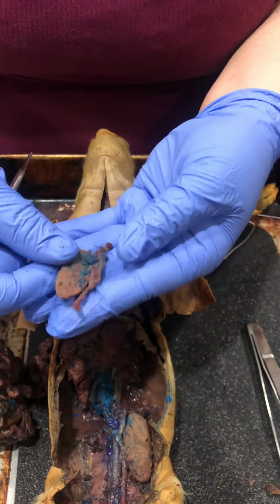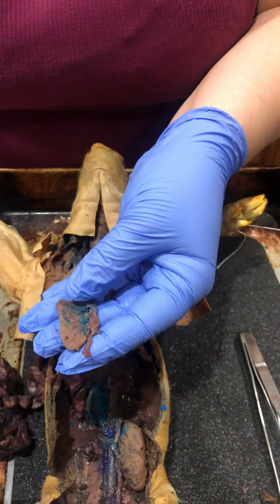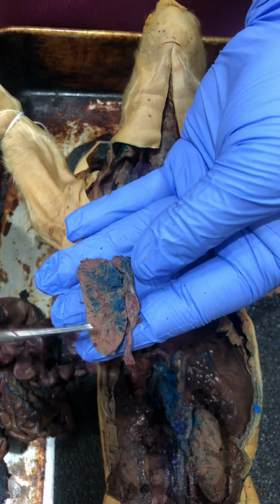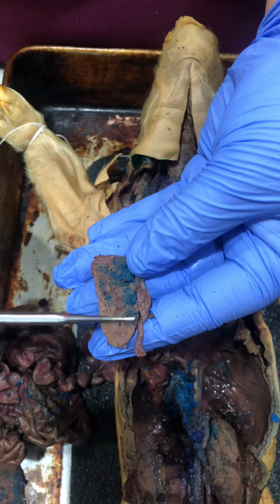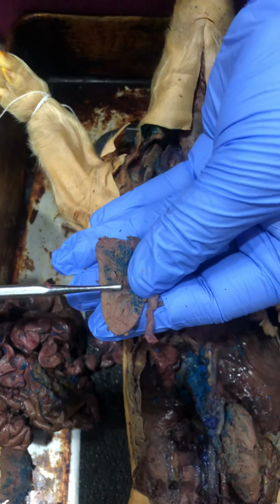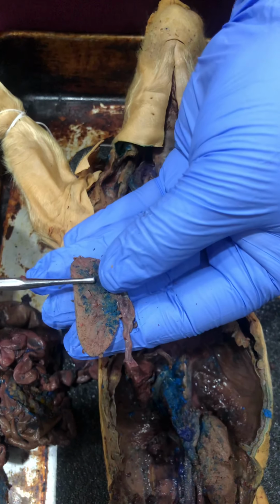So usually the renal artery is behind the renal vein. And then again, these are the ureters that go down to the bladder. So this is the inside of the kidney. And then right here, you can go ahead and tell it's the renal cortex. So that's the outside portion of the kidney. And then the inner part, where if you can see, like me spreading it, you can kind of see the little areas. That's the renal medulla.